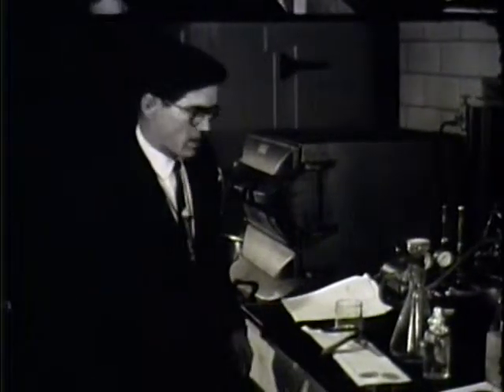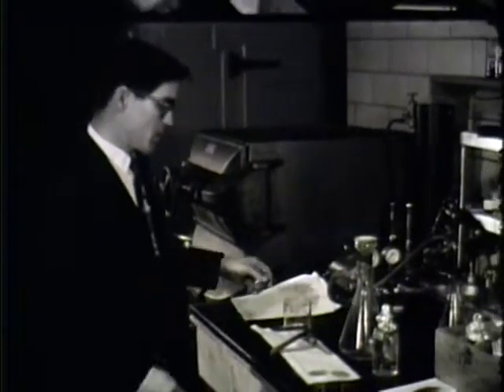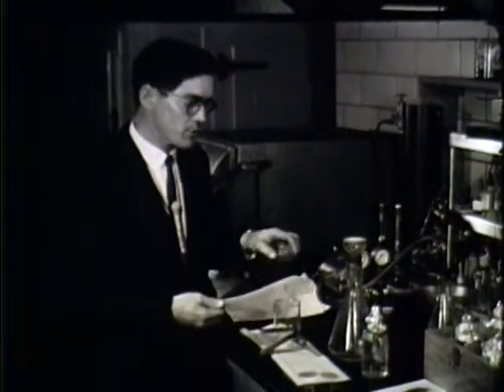Now, there were a number of other samples which you saw taken out in the boat. We can go over to the other part of the lab here now and perhaps see what is done with some of these other samples. This area of our laboratory is our bacteriological center. In this region, we analyze some of the samples taken on the lake further.